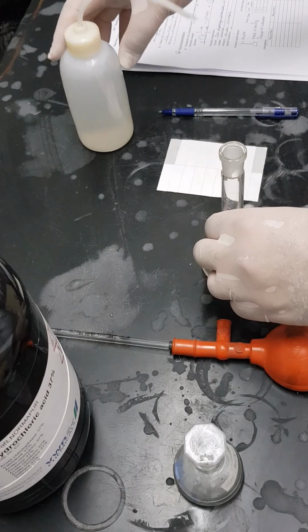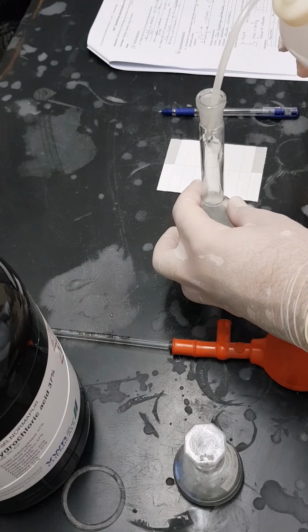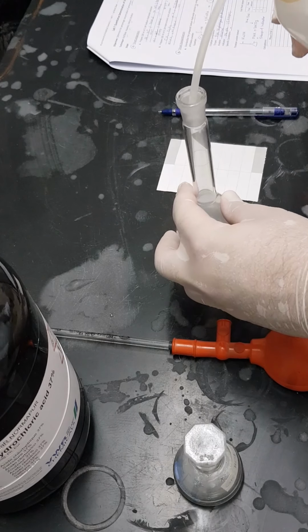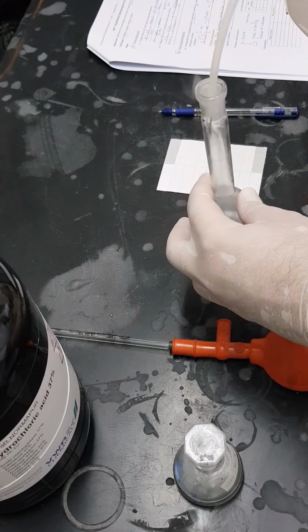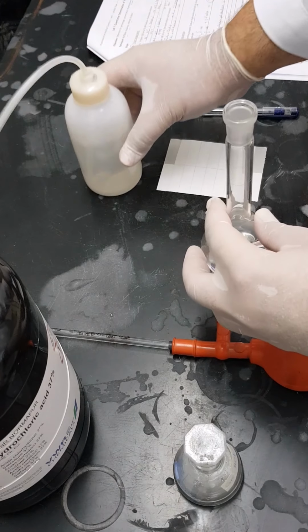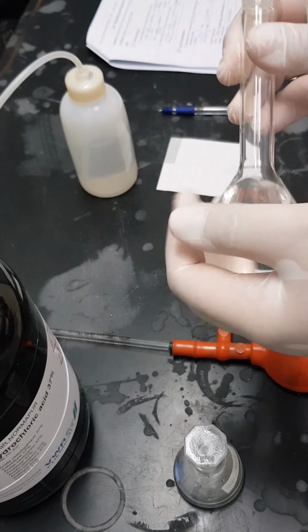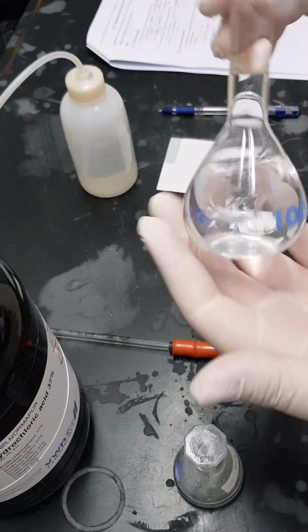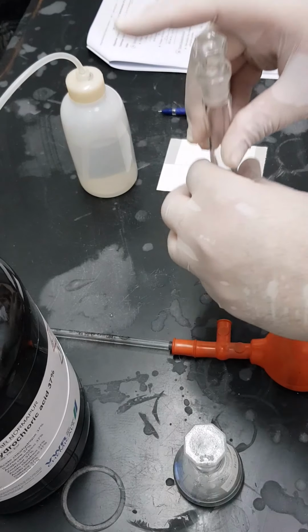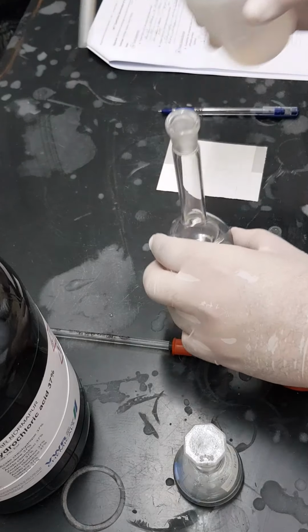Now we will add distilled water. As we said, the amount of HCl added is not that much, so it's okay if in this case we add water to acid. Then we are going to gently mix it. I'm sensing the flask, it's totally at room temperature, so it is not overheated, as what will happen if we are going to use a huge amount of concentrated acids.